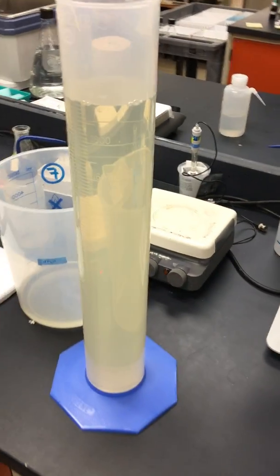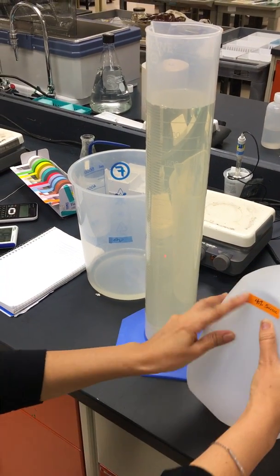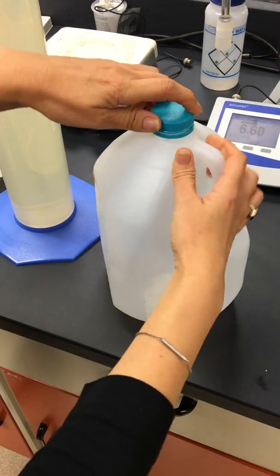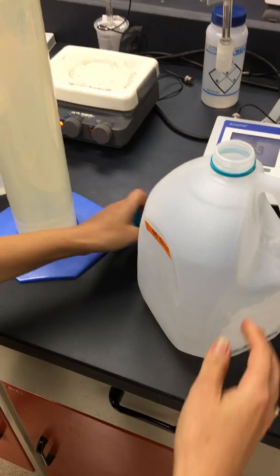I've got a milk jar here and I put down what this is — so 40% sucrose — on a piece of tape, so we don't get confused, because there's going to be a few of these and they're all going to be different solutions. So this one's 40%.